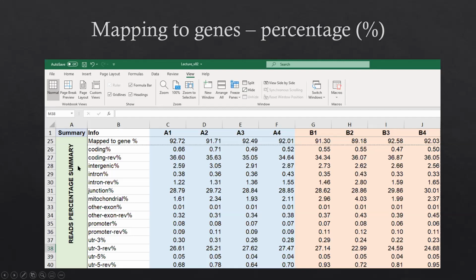And as I mentioned several times, because this is messenger RNA-seq analysis, we don't expect a high number of reads to be located in the intron. If you find that the ratio is pretty high, then you have to go back and check the sample quality. There is also an important row, the mitochondrial percentage. You can see in this case, all the mitochondrial percentages are pretty low, except one sample, B2, a little bit higher at 4%, but in general, all are under 5%, which is good. If you find a higher mitochondrial percentage, like 10% or even much higher, 20 or 30%, then you have to check the sample quality as well.